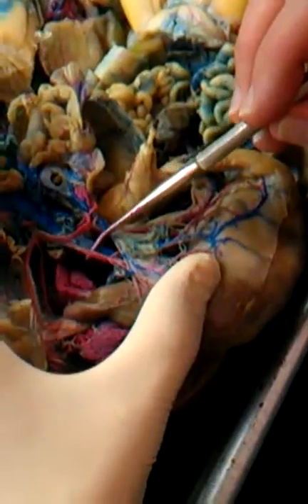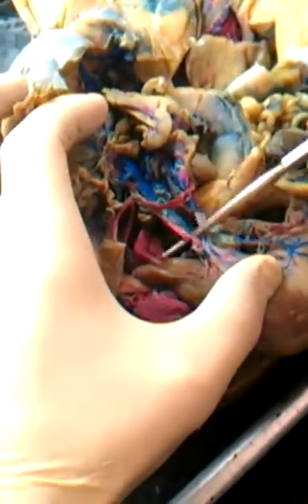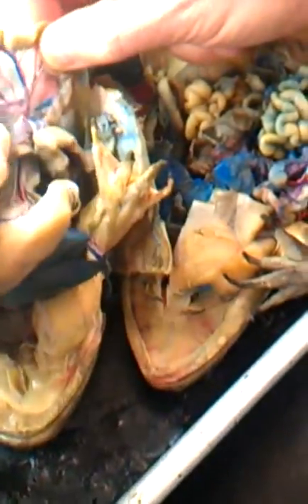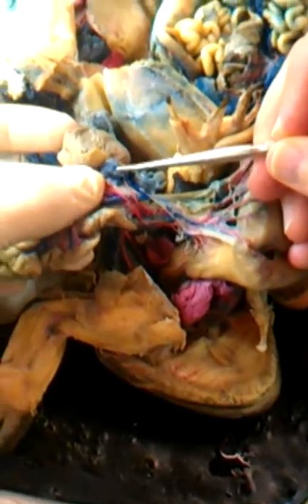That divides into, let's see here, you guys may have to remind me on that one. A celiac artery and anterior mesenteric. Does that sound right? Yeah. Okay. And then you have to know no branches of the celiac, but from the anterior mesenteric, you have to know the branches that go to the intestine. Those would be intestinals, all of this red here in this big fan, or the main line is the intestinal. There is a side one. Everything's gotten flipped around so much here that's a bit hard to see, so sorry for all my manipulations. But this little tiny one right here, which leads to the spleen, is the splenic.